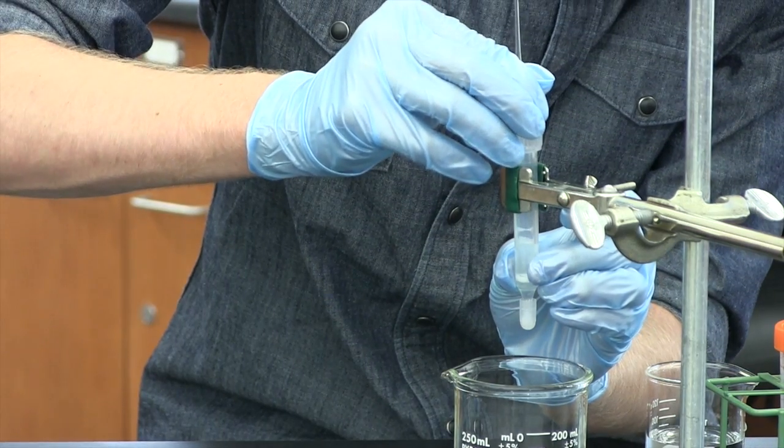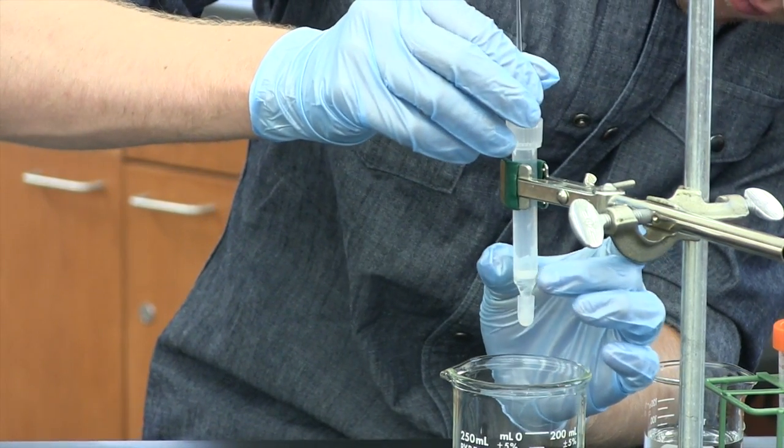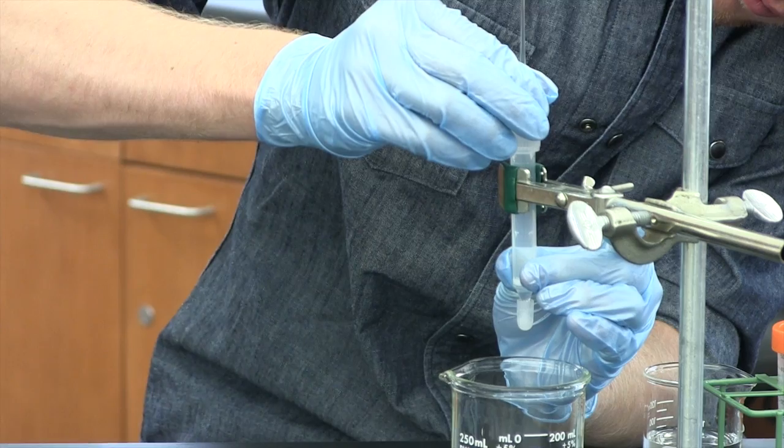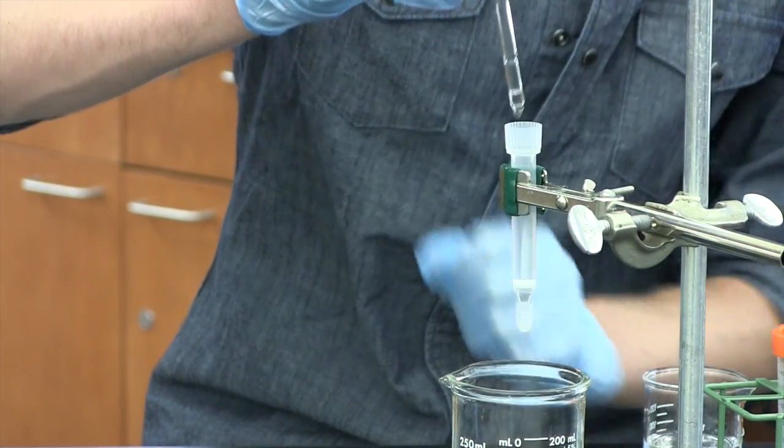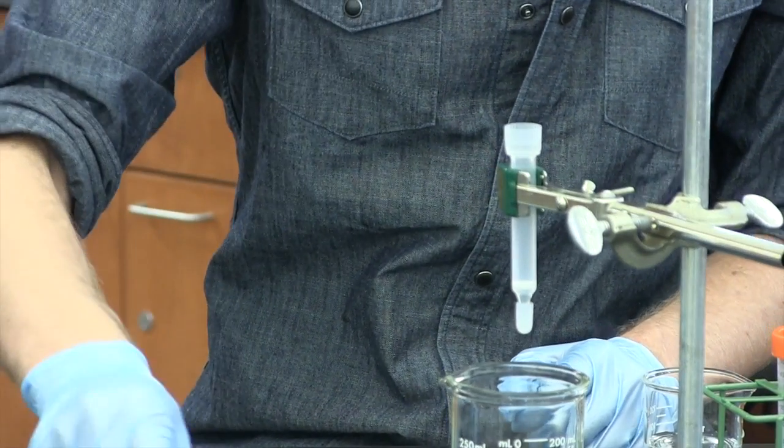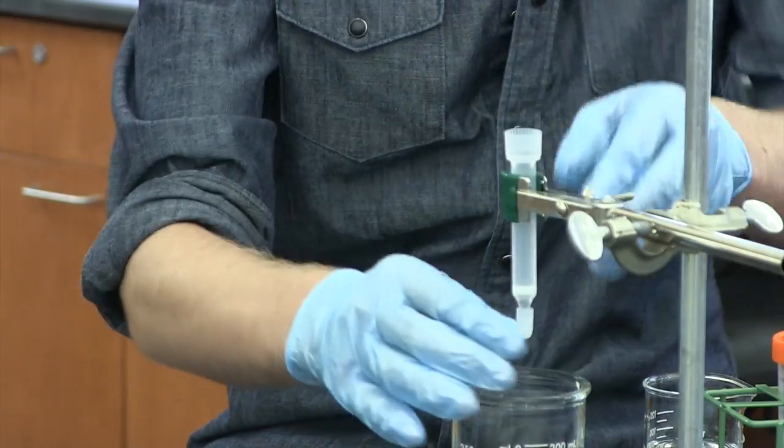It's okay if you get a little air bubble stuck under there, you just don't want it to be all air underneath or you'll get a lot of back pressure and it'll take forever for your column to run. Once the frit's down, you can take the cap off and just run that buffer down.